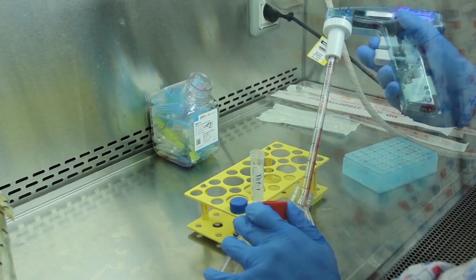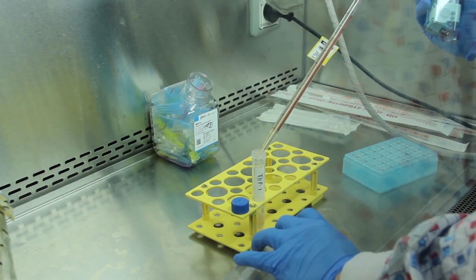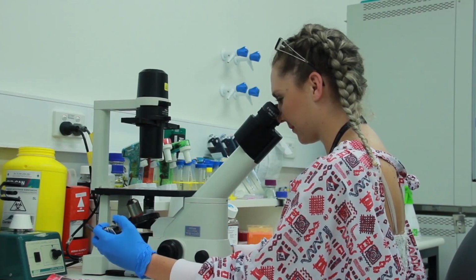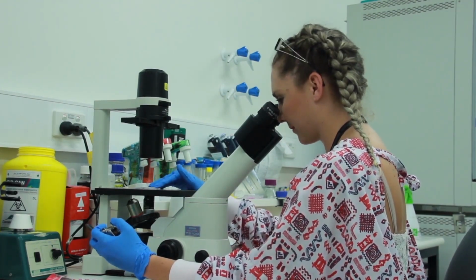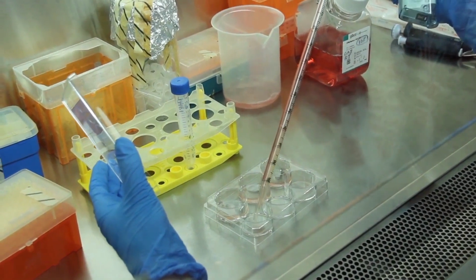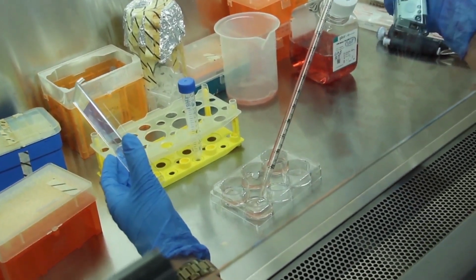Part A. The induction of apoptosis. To induce apoptosis in cell lines such as THP1 monocytes, first start by collecting the cells. Count cells and collect approximately 10 million cells or as required. We recommend 10 million for Western blot analysis of apoptotic bodies. Aliquot 2 million cells per well of a 6-well plate.